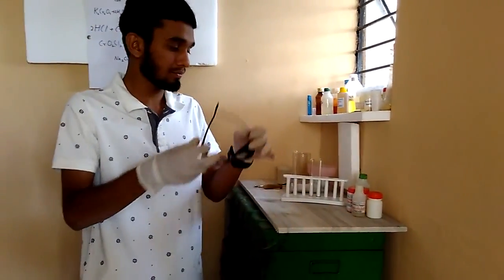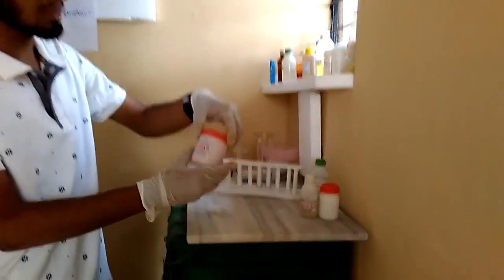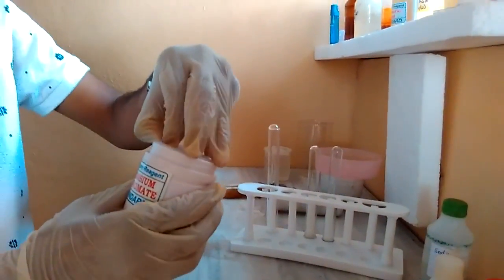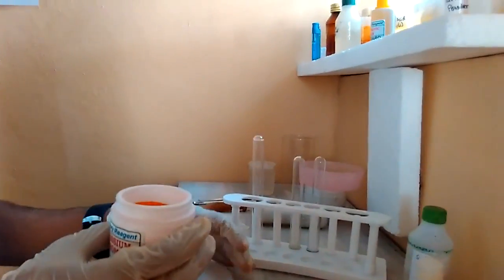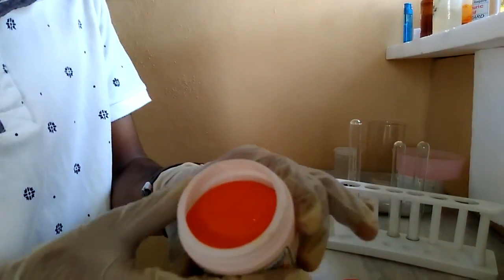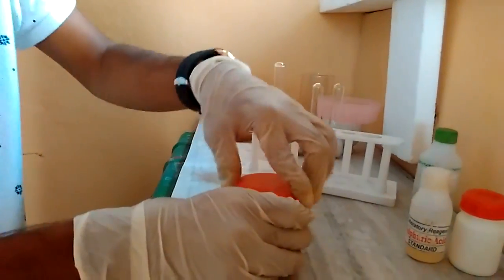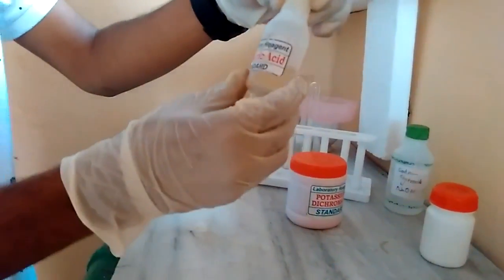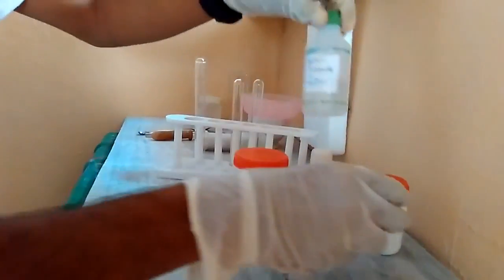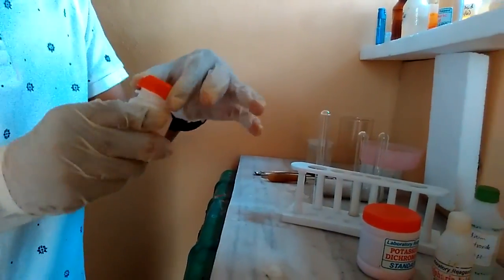I will put on my safety gear. I have some potassium dichromate with me. Please be careful while handling this potassium dichromate — put your safety gear on because it contains Cr6+ which is carcinogenic in nature. You can see that it has a very good orange color and is a very good crystal. I also have some concentrated sulfuric acid, sodium hydroxide, and a chloride — in this case, sodium chloride, which is a white crystal.